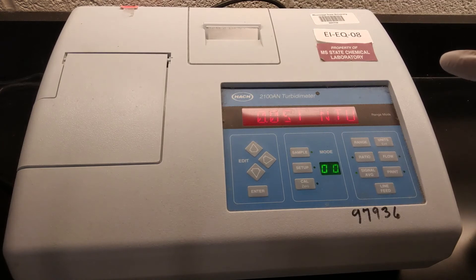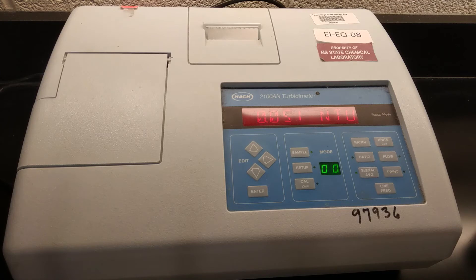You're going to want to take that measurement and write it down. This unit does have a built in printer, but I think it just doesn't get used enough. The heat activated paper doesn't work right. The printer doesn't feed well. So it's easier to just write it down.